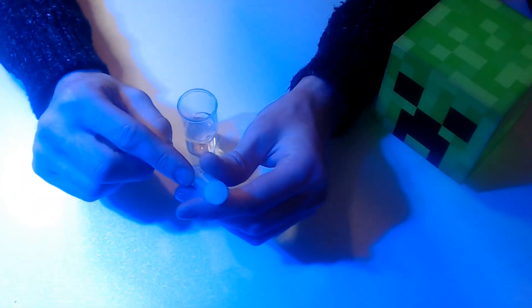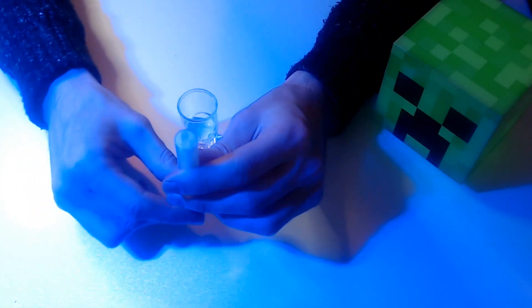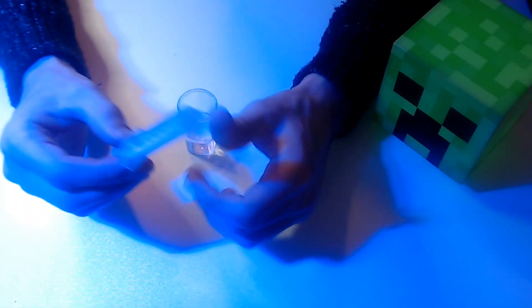Little word of warning, you will get bubbles. A couple of taps, eject it up and then you're good to go.